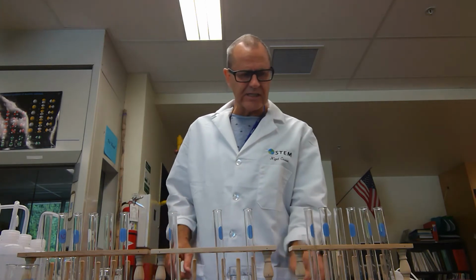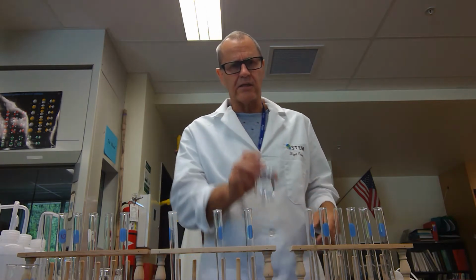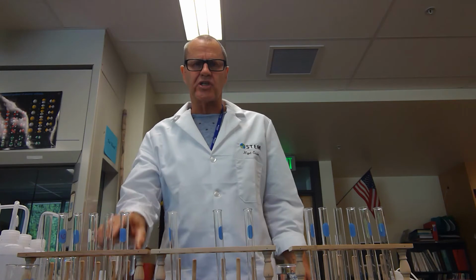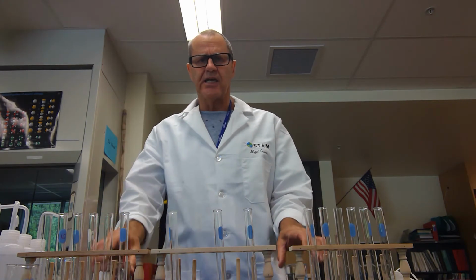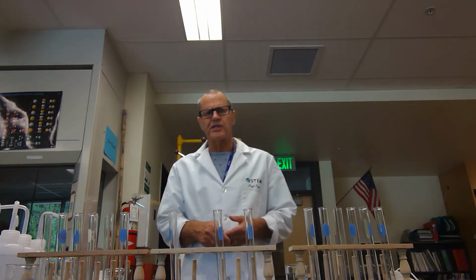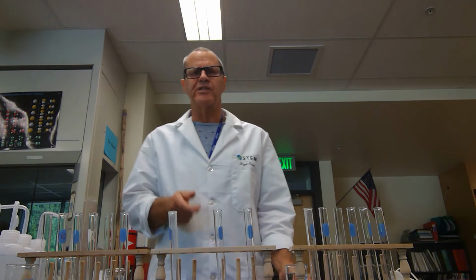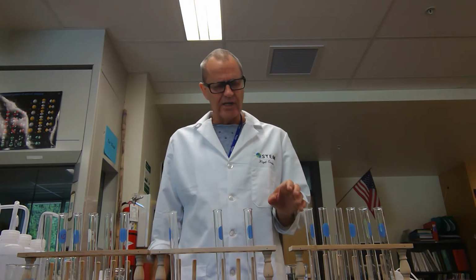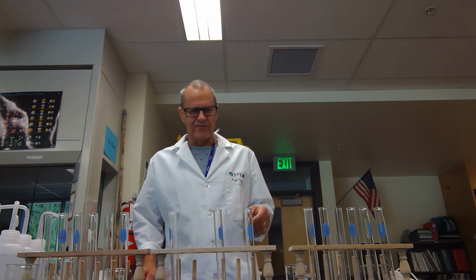One of those series for the serial dilution is with HCl, the hydrochloric acid, and one is NaOH, the sodium hydroxide, the acid and the base. You'll notice that it says 1.0 molar, and I measured it out a little more precisely than that, so it's 1.00 molar, and I'm fairly sure of that. The next decimal point I'm not so sure of, but this is fairly precisely done, unlike my first step.